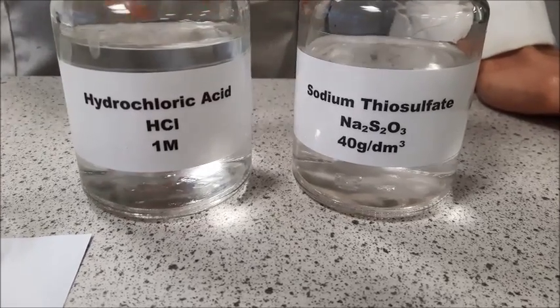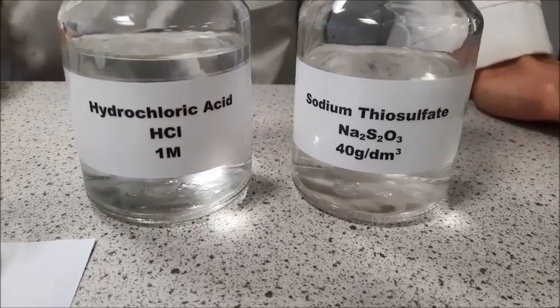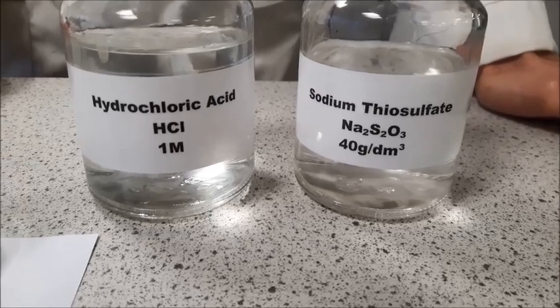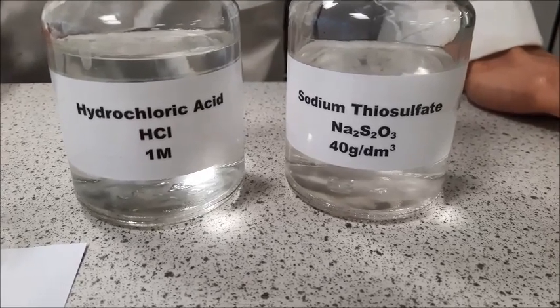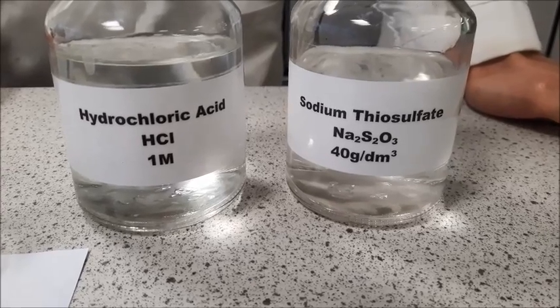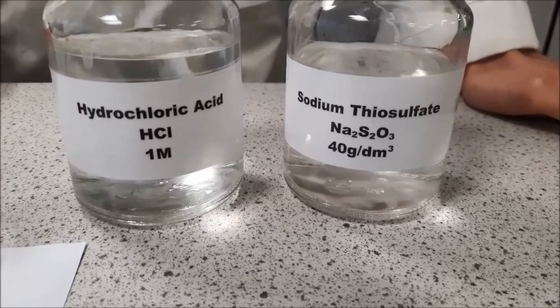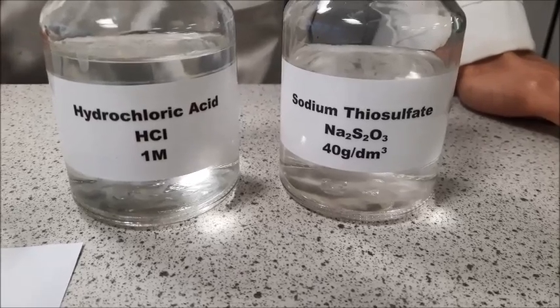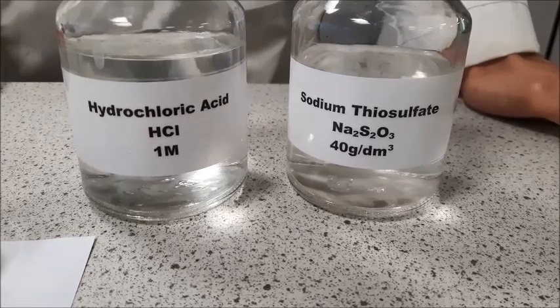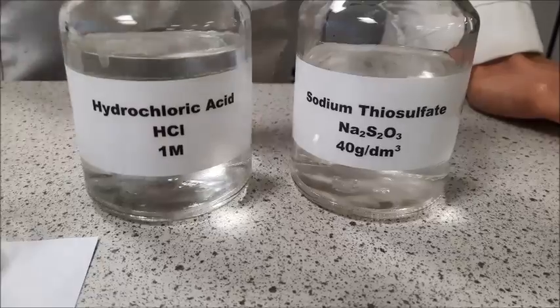Now when these two solutions react, they will make what's called a precipitate, which is a solid made from two liquids. That solid is going to make the solution go cloudy, and eventually it will be so cloudy that you cannot see through it, which is the basis of this practical. One of the side effects is it also creates sulfur dioxide gas, which can irritate the lungs of people with asthma, so we need to try and prevent too much of that gas being produced. So when you're clearing out your bottles, make sure you pour them into a stop bath.